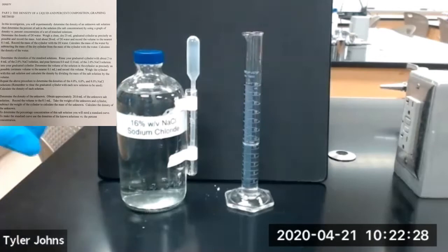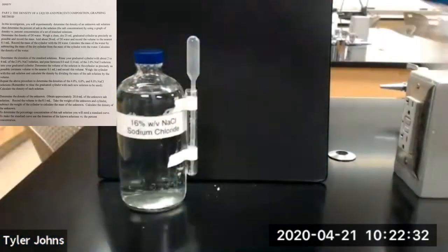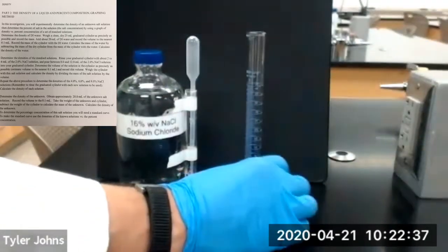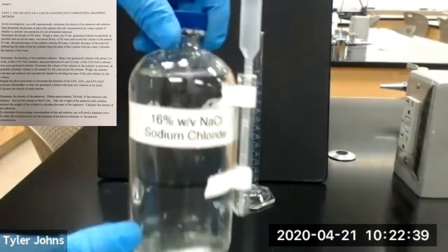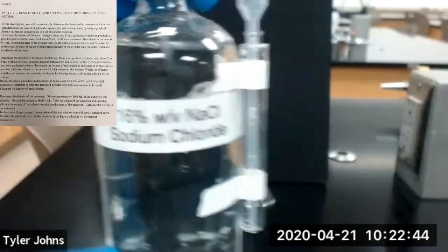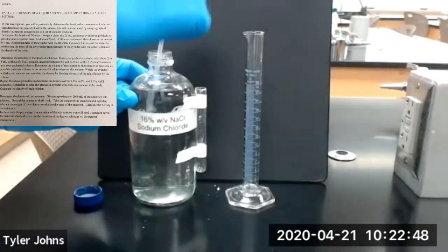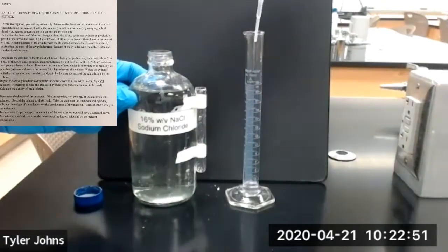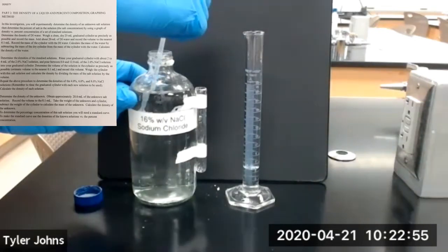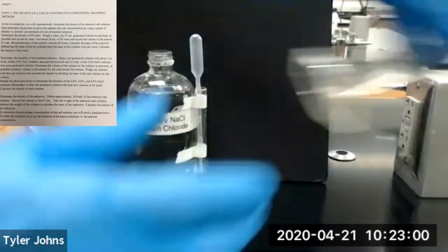So now we're moving on to our last standard salt solution. We're going to dump the remaining 8% standard salt solution. Our last standard salt solution is 16% sodium chloride. So we're going to rinse with a couple milliliters. Dump.